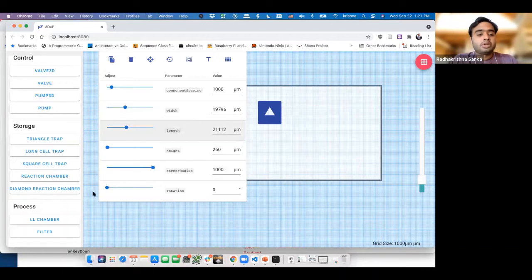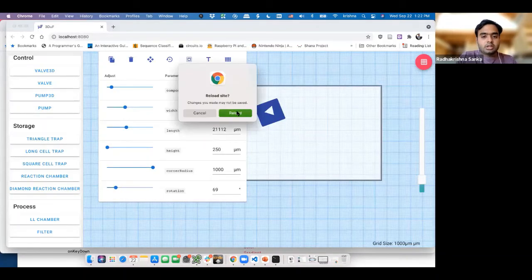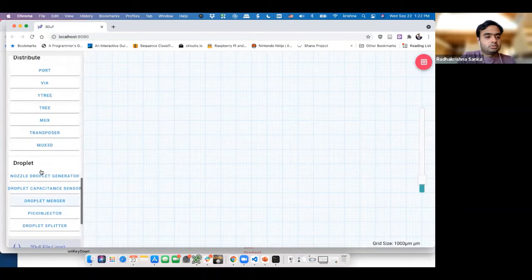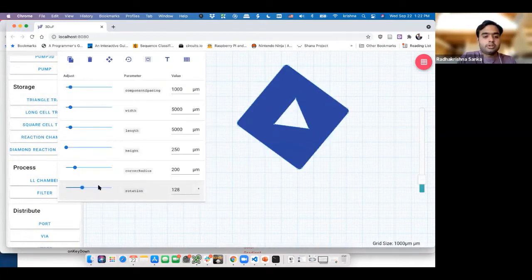So this way, what you're able to do is, and similarly by pushing this along, you notice it's slightly off because of the way we set the rotation origins. But the idea is that by just doing this, you're able to quickly figure out how you want to do the whole design. Now, for example, if I said rotation over here was always set to 0, then we'll fix that little bit of rotation issue. Trap. And there you go. Now it looks clean for rotation.